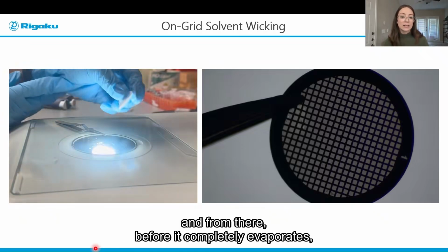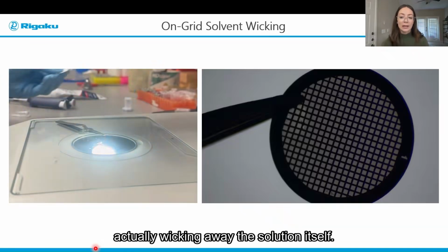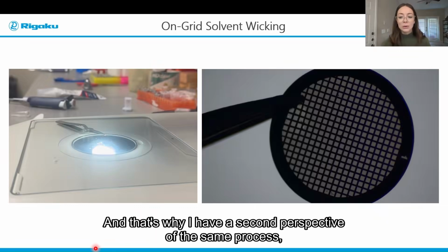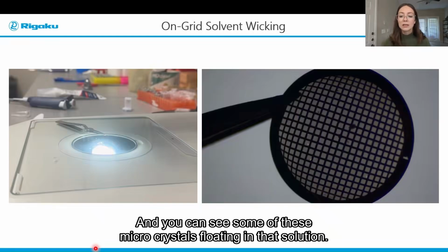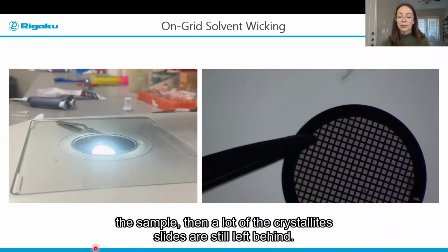And from there, before it completely evaporates, you want to use a piece of filter paper and touch it to the solution, actually wicking away the solution itself. And you might be thinking that I just removed everything that I just put onto the grid, and that's why I have a second perspective of the same process, where in this case I'm again depositing that solution, and you can see some of these microcrystals floating in that solution. And when I take my filter paper and blot the sample, then a lot of these crystallites are still left behind.